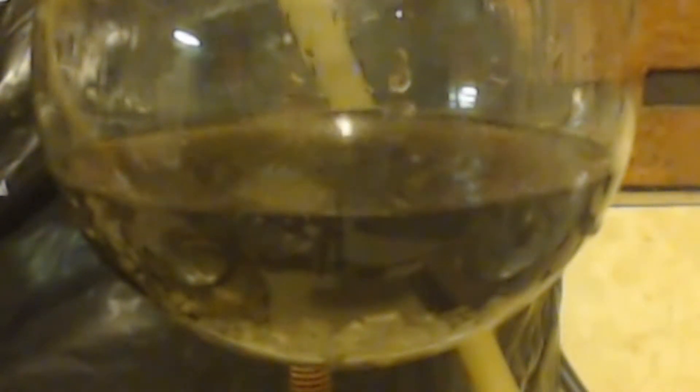That's from the condenser. I don't want to see the whole thing filled up. You can see it is taking some of my magnesium. This is taking a lot longer than I thought, it's taking forever. I'm just going to keep putting ice on it or hot water, or whatever it takes time. I still have this much left, I still haven't put much in since last time because it seems like it needs more time to react with what's in there. As soon as I shook it, it does seem like it's eating that metal up now.